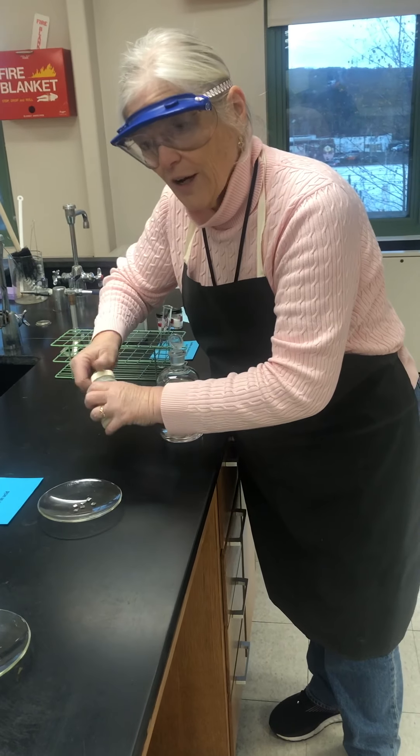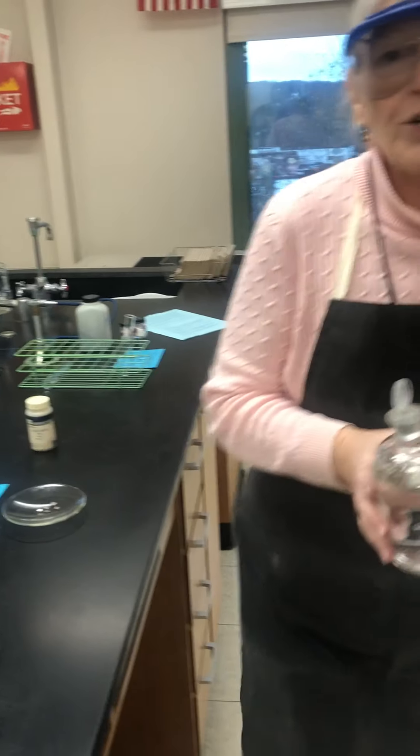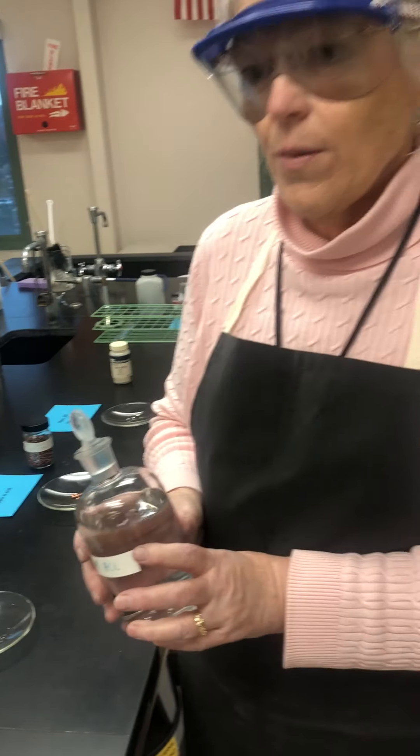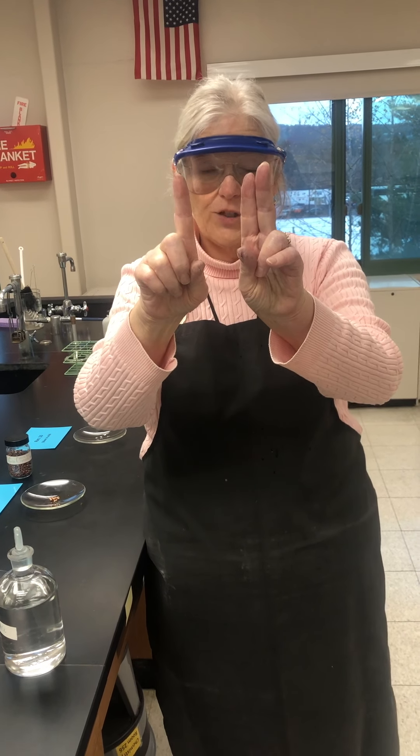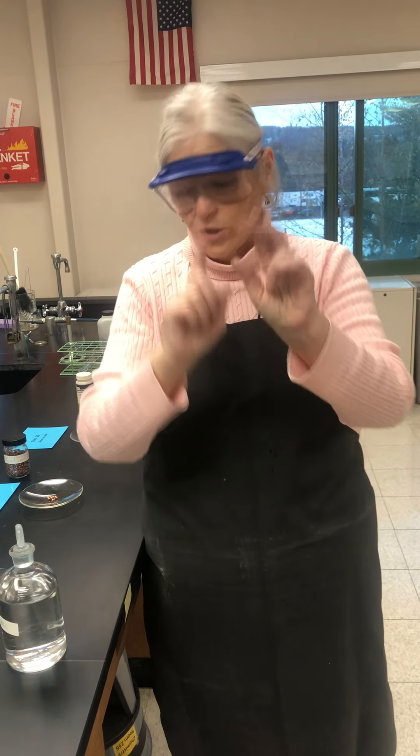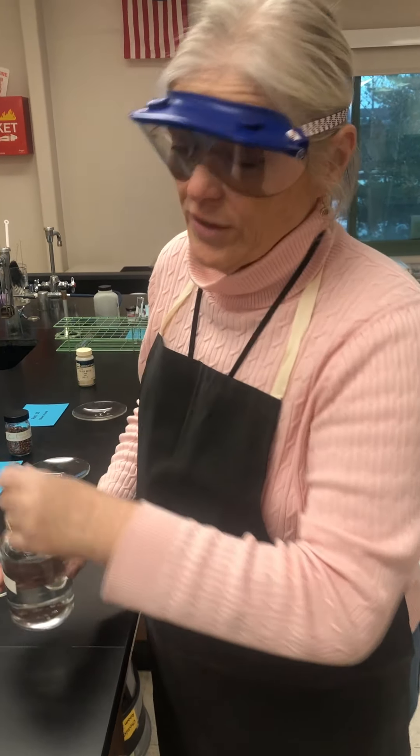Will these reactions occur? You should now know how do you test whether one of these elemental metals will react with the solution of hydrochloric acid. Will this reaction occur? Well, you have the benefit of seeing it.